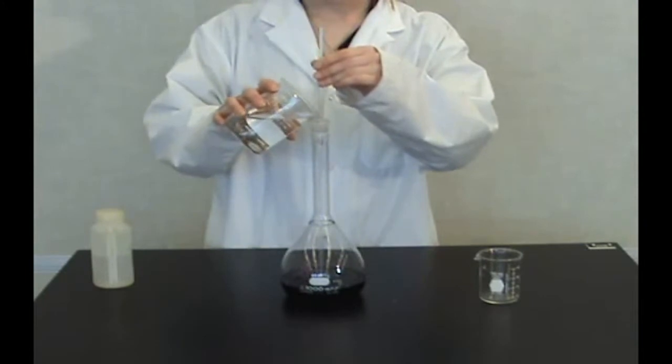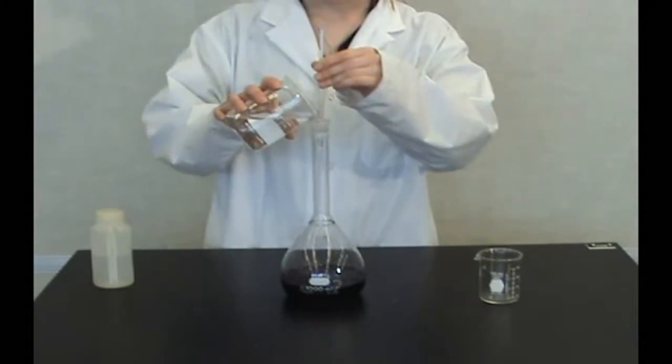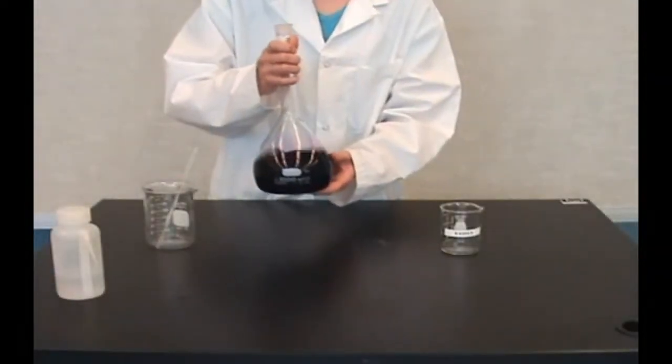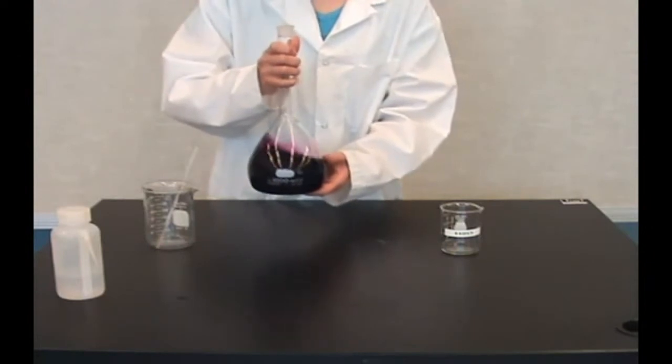Add some distilled water. When the flask is approximately half full, give it a swirl to mix the water with the solution.